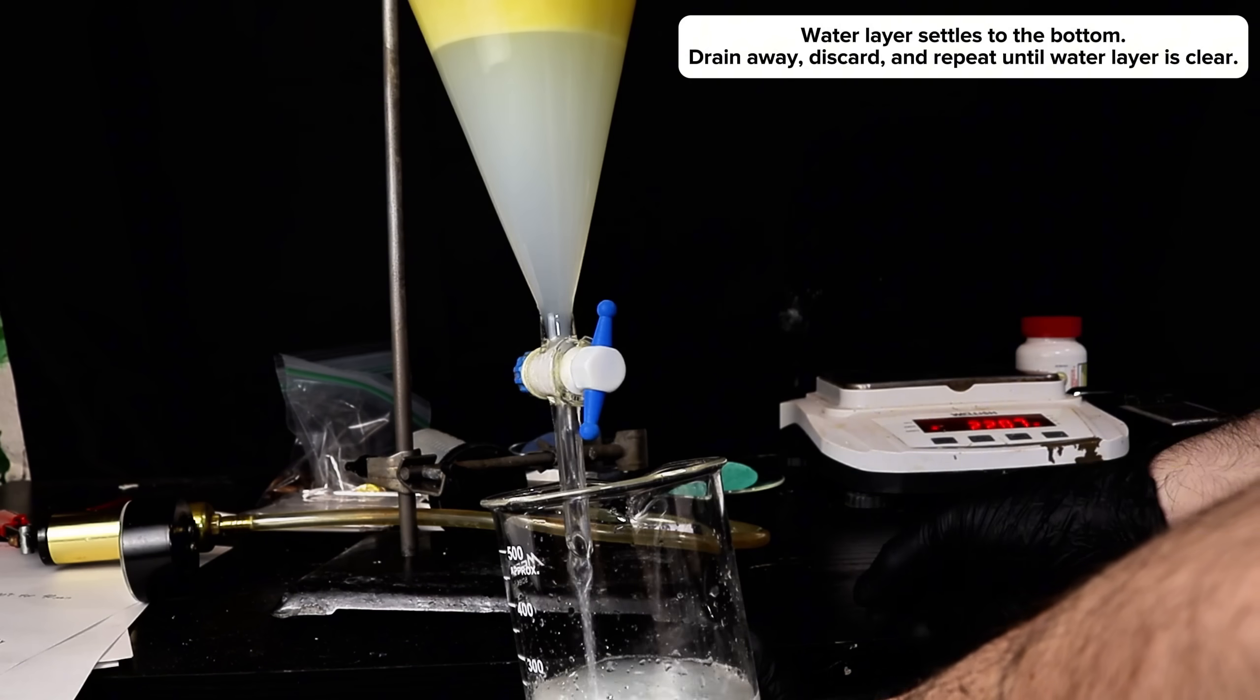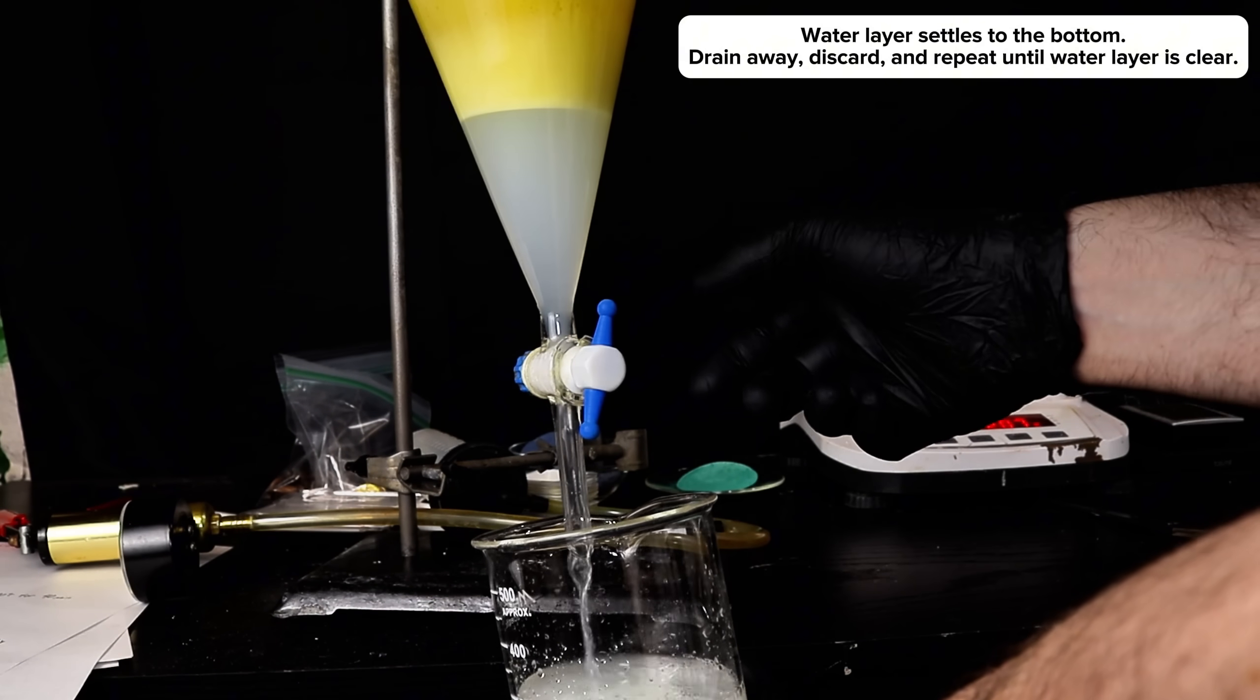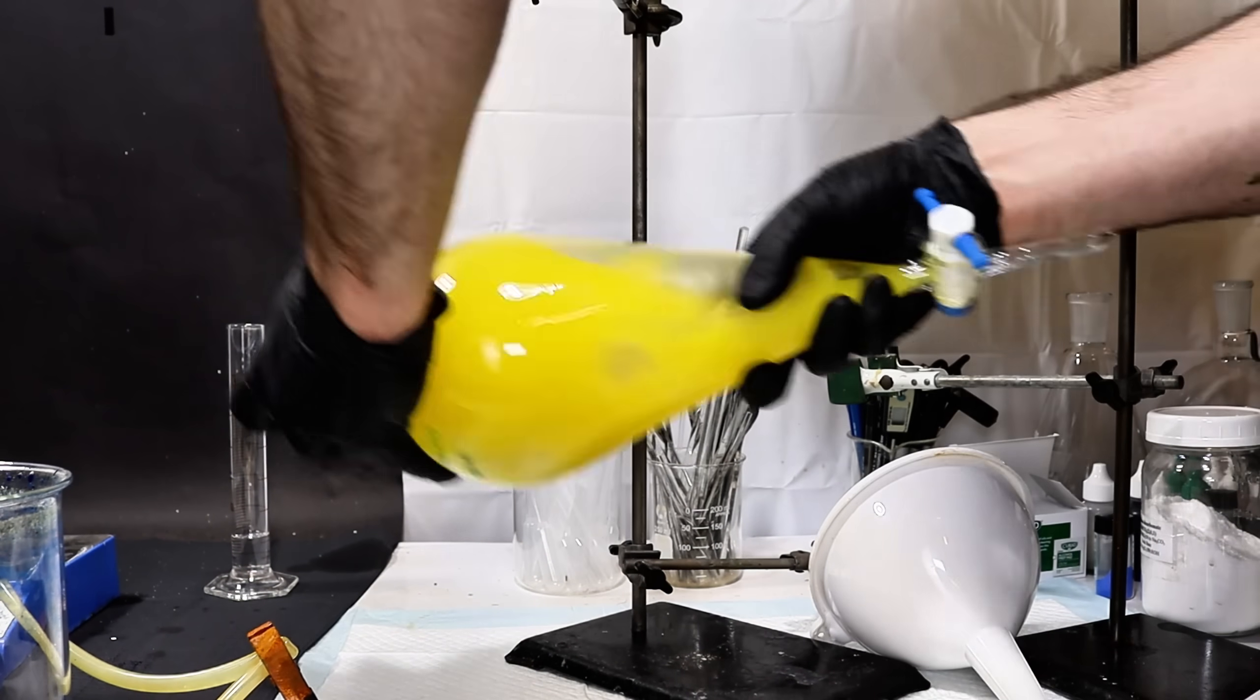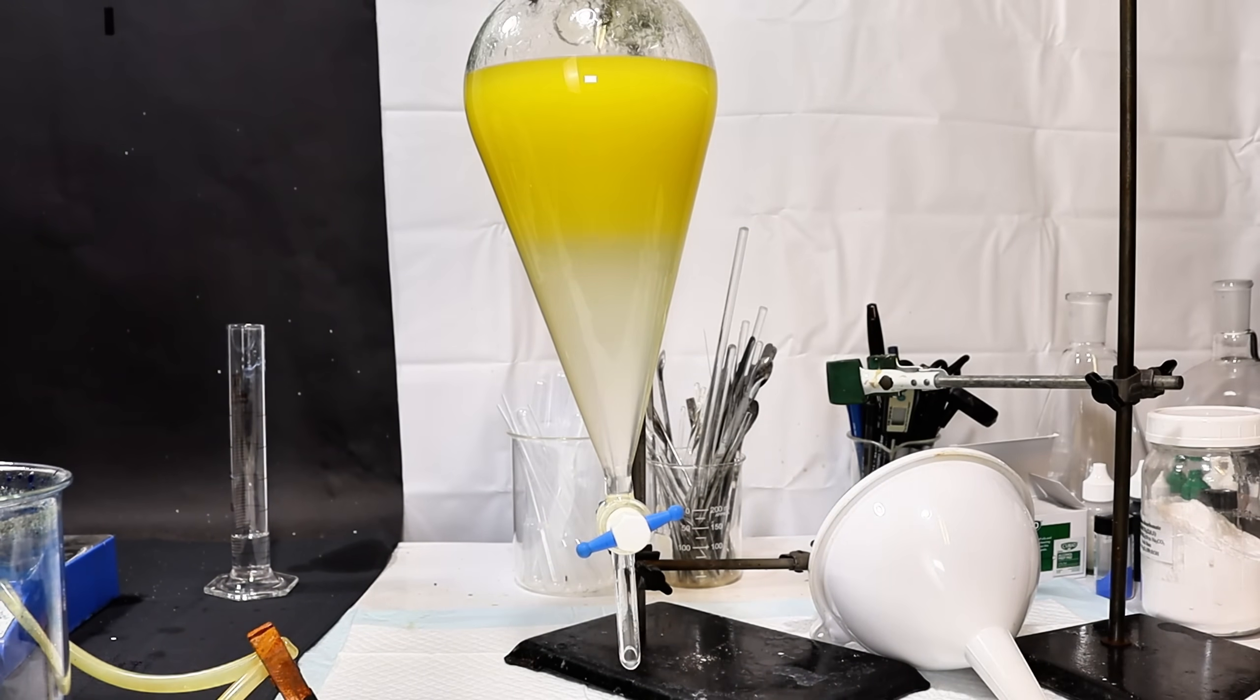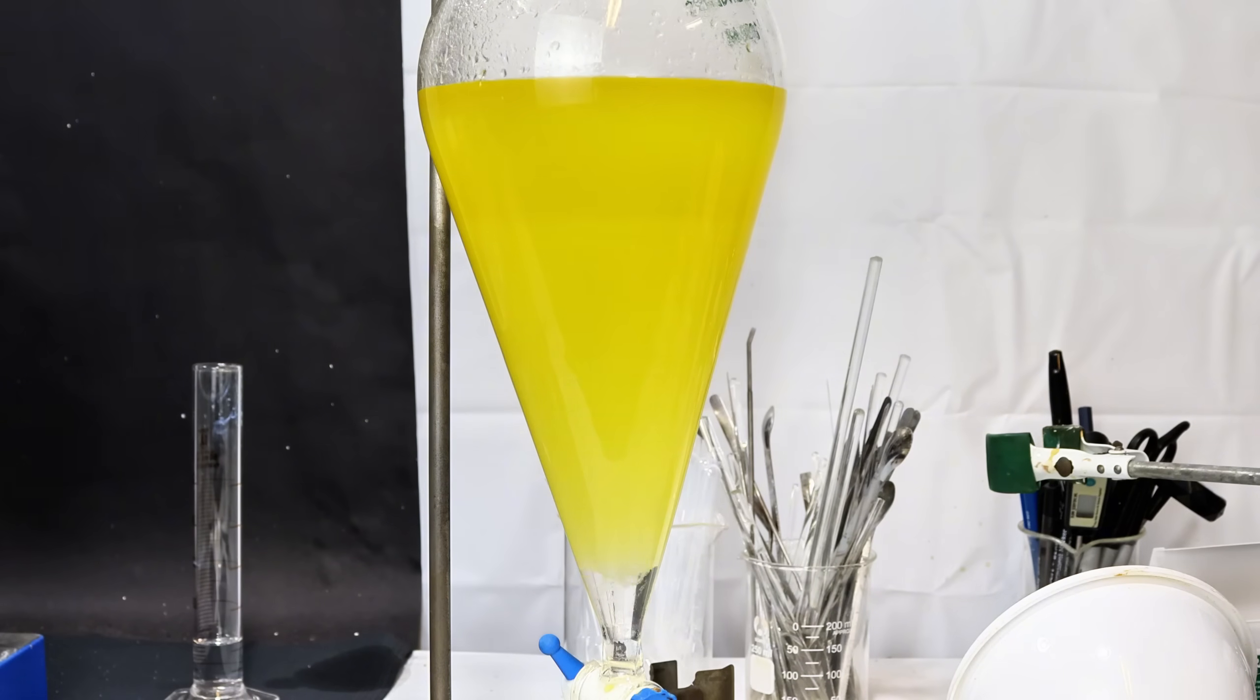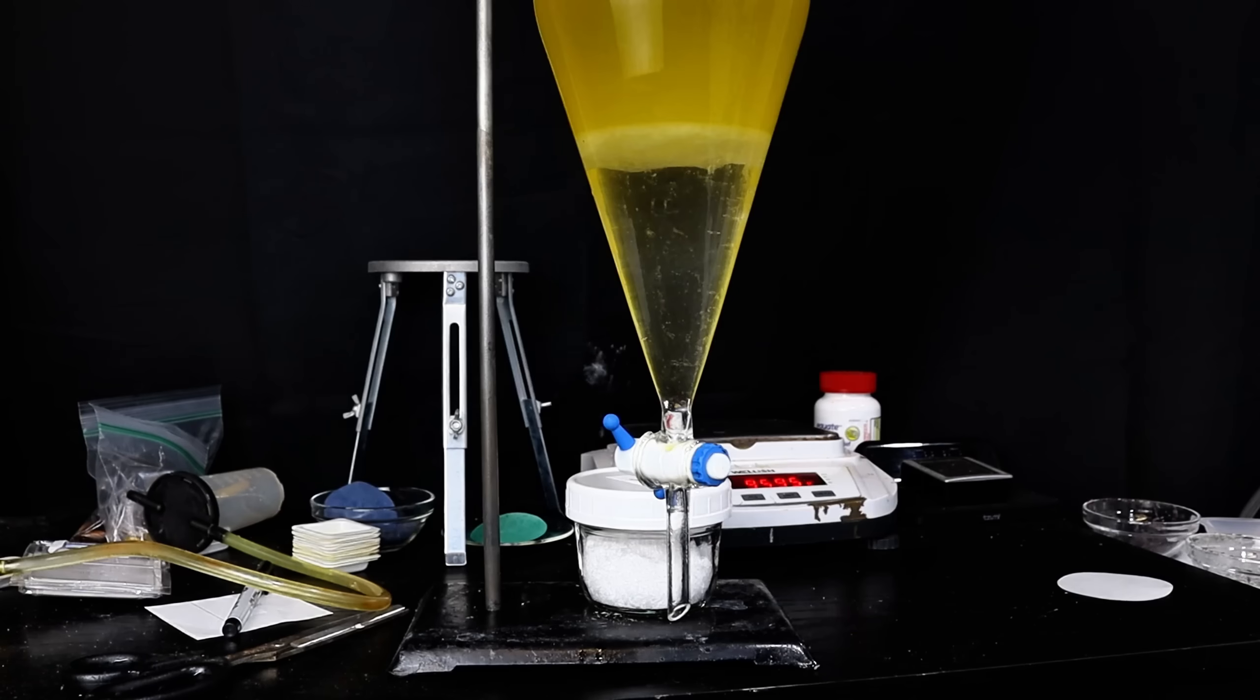There shouldn't really be any unreacted oil present as any fatty acids that didn't convert to biodiesel simply became part of the soap. The rinsing step is repeated two more times until the aqueous layer is completely clear and the layers separate very quickly due to removal of any surfactant molecules.